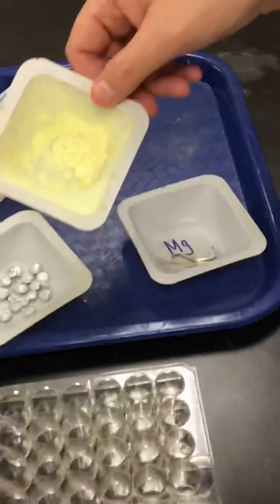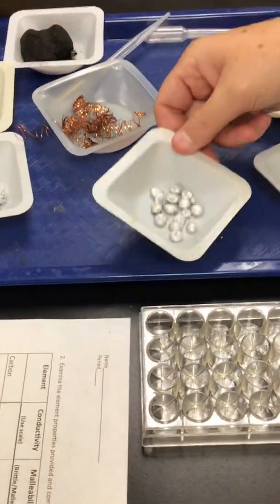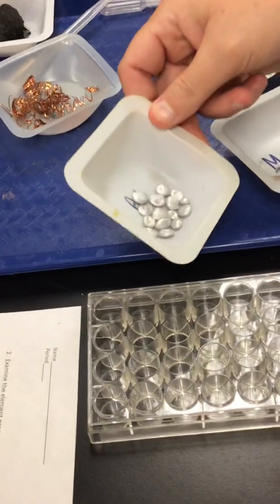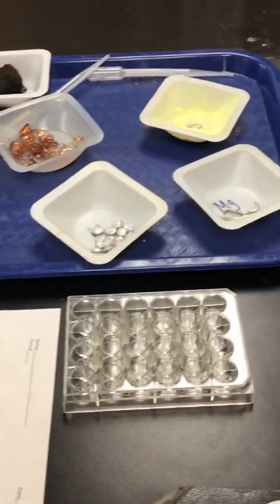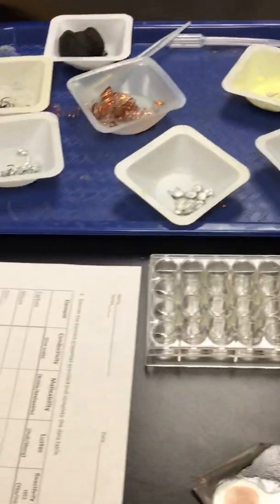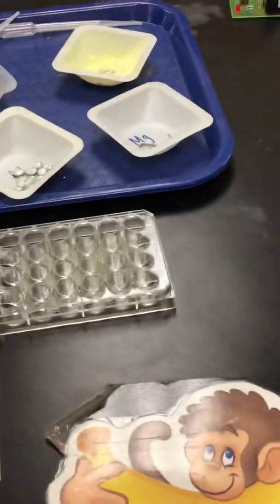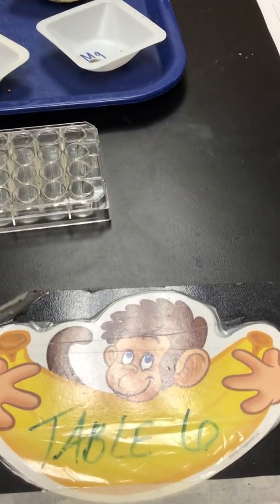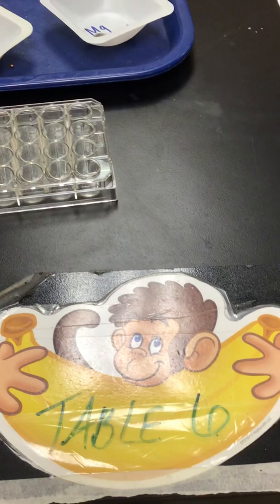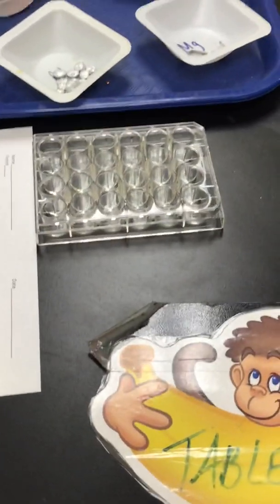Sulfur. And aluminum. All right, the last test we have to do is we're going to put our stuff in hydrochloric acid and see if it reacts or not. Ms. Castro, do you remember how we check if it's reacting or not? What are some things we can look for? We can look for bubbles, we can look for heat, things like that will show us if there's reactivity. Awesome. So we're going to be looking for bubbles, I guess, or some heat or some kind of film.